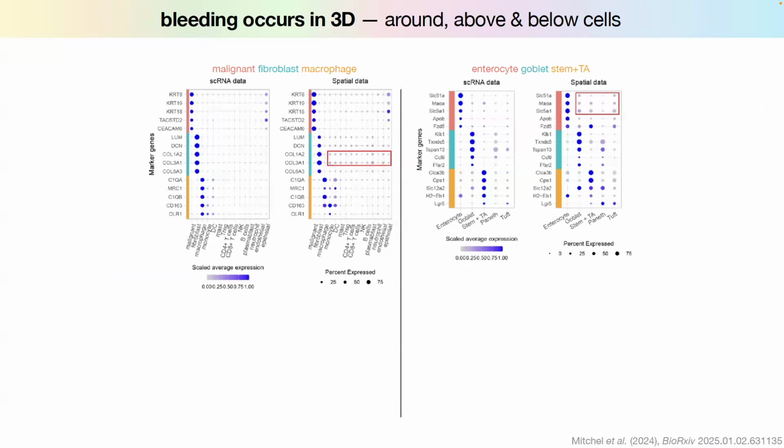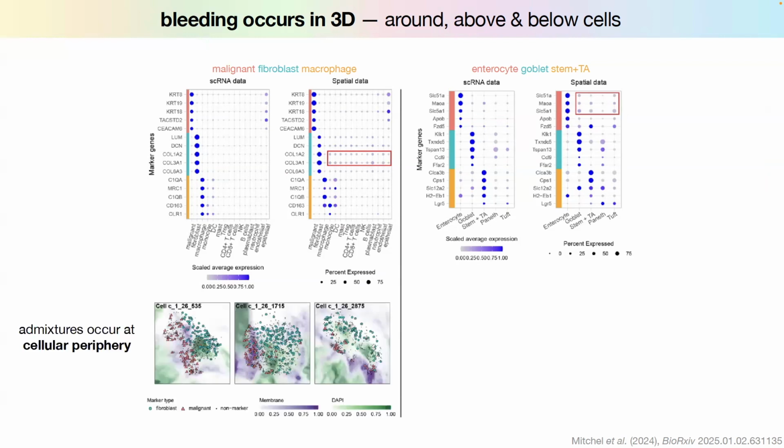So this is, again, the same story, but in a more systematic way. Whatever I just showed you was things I saw, but then there was a paper, I think it just came out a couple weeks ago, where they take single-cell RNA-seq data and spatial data, and they show that there are these artifacts of markers that shouldn't exist. And then they try to characterize that. So here in turquoise, we have fibroblast markers, and in red, malignant markers. And usually it occurs on the sides of the cell, which makes total sense, because usually it's your neighbor that is infecting you.